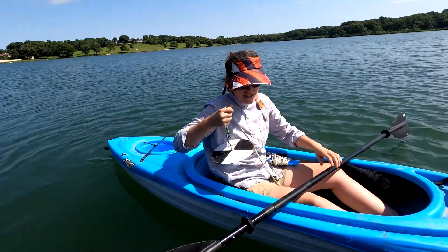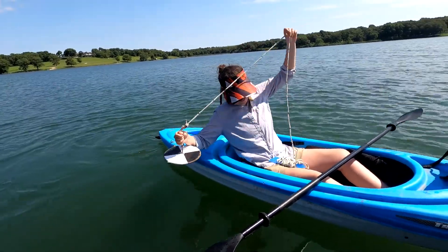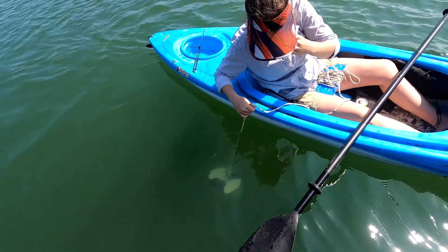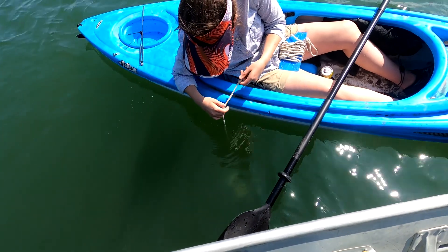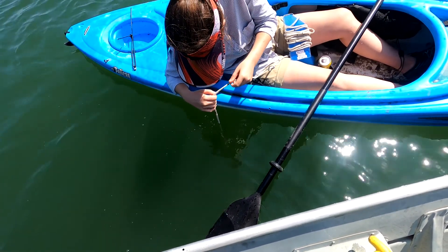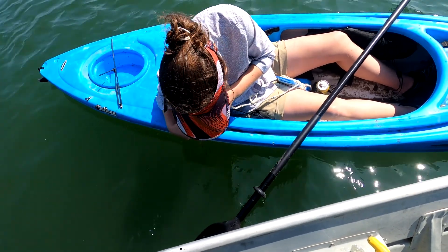So I'm going to do it now. I'm going to do this on the shady side of the boat, so I'm going to move away a little bit so I can get one. It's the shady side. This is a pretty cloudy lake, so we'll see how much we can get. Being on the shady side helps you get rid of some of that glare.